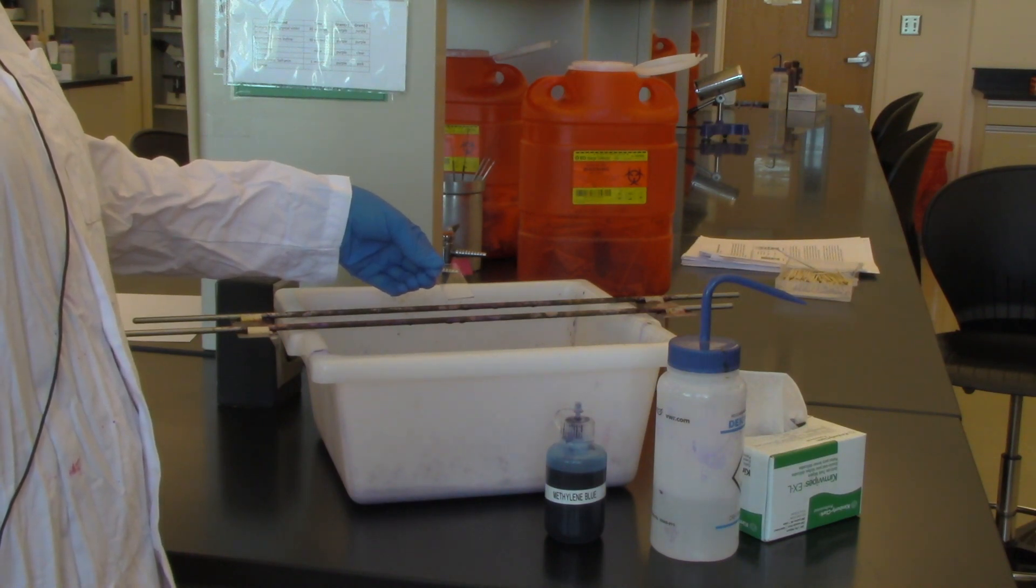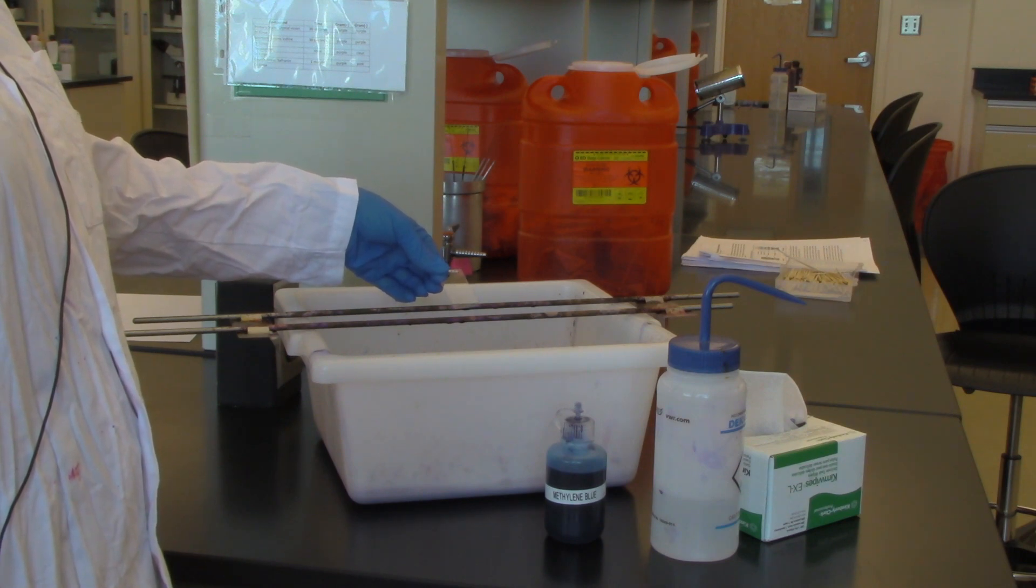This is the simple staining procedure. So we have a slide here that has specimen affixed to it.